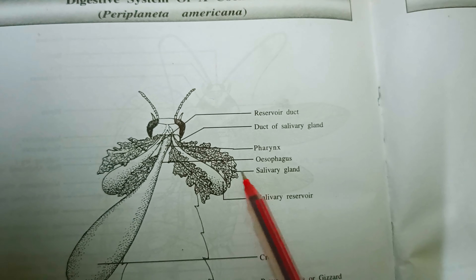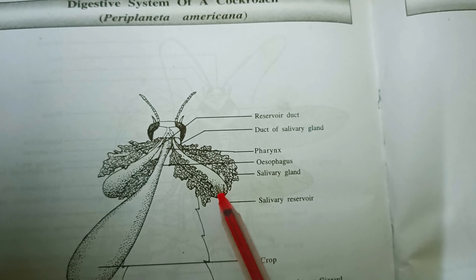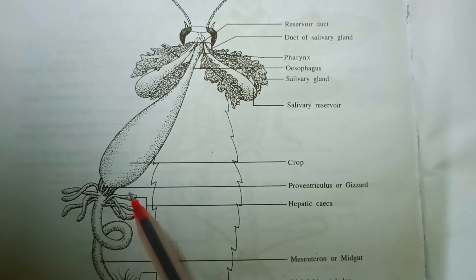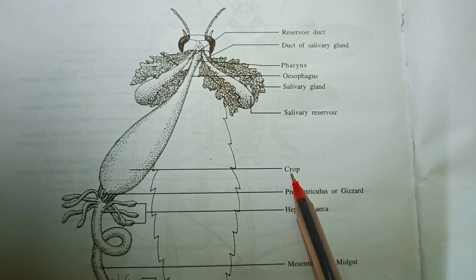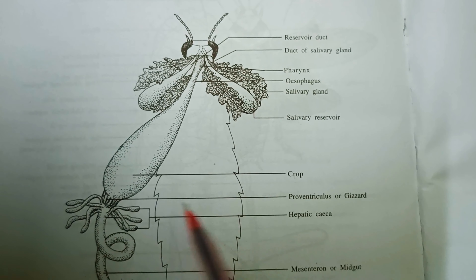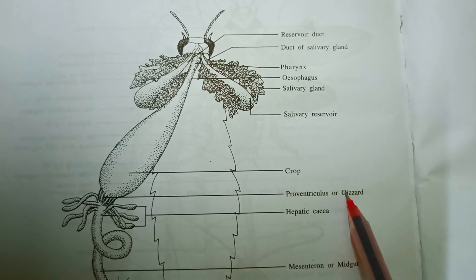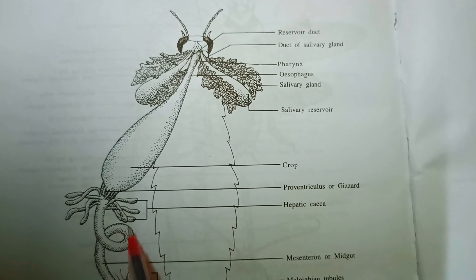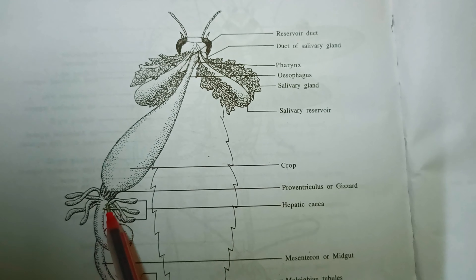And then salivary gland comes, and then salivary reservoir. This is actually the salivary reservoir. And then this part is actually the crop. And then this joining part is actually the gizzard. And then hepatic ceca comes — this part is actually the hepatic ceca.